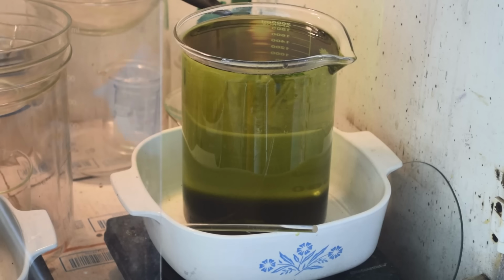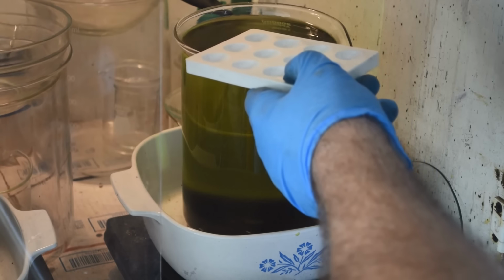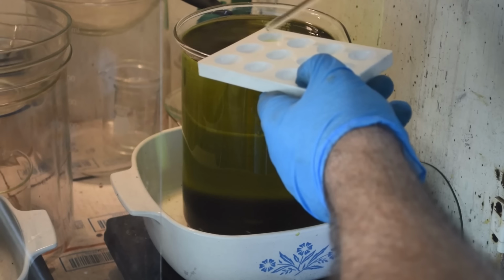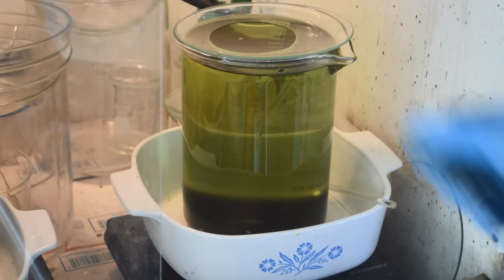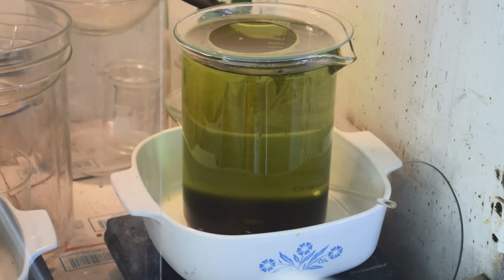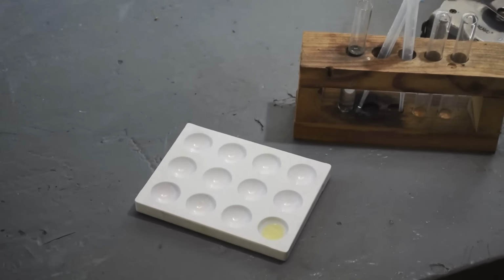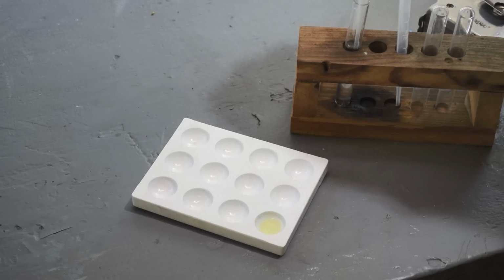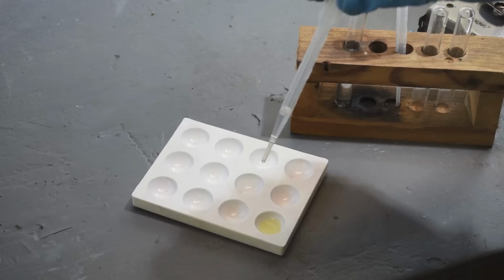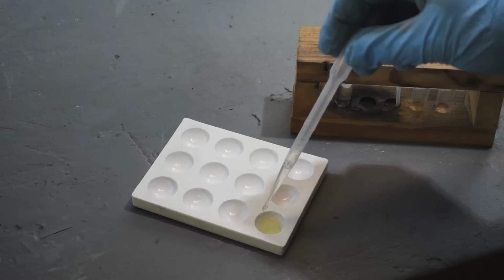Anyway, let's see if we've got all the gold out of solution. Get a little bit of this liquid up here. All right. I'll take it over to the bench and do a stannous chloride test on this green stuff and see if we've got any gold left in it. All right, let's hit it with a little fresh stannous chloride. I've got a video on how I make stannous chloride whenever I need it, pretty much on demand. It's quick and easy, and it's always fresh.